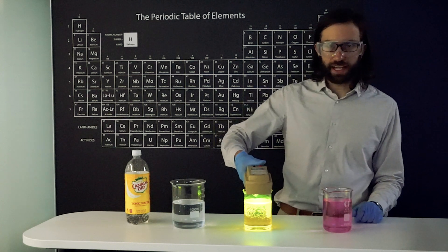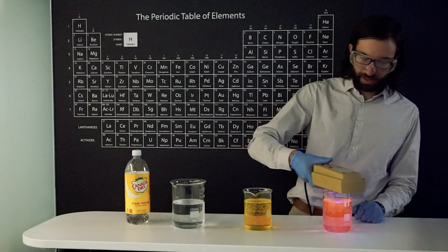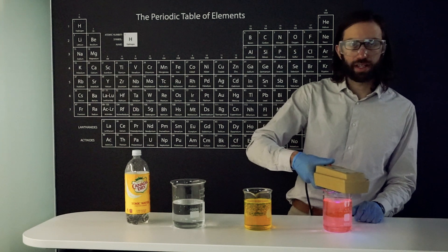Fluorescein, it's kind of a neon yellow. And rhodamine B, it's an orangey color.